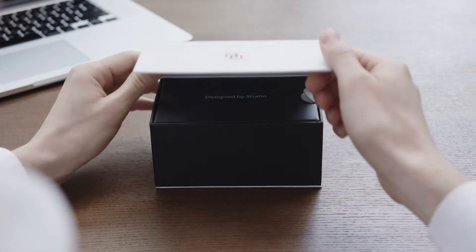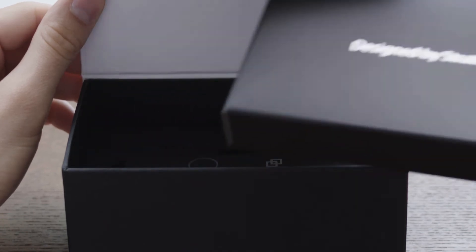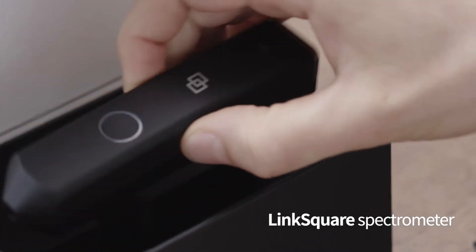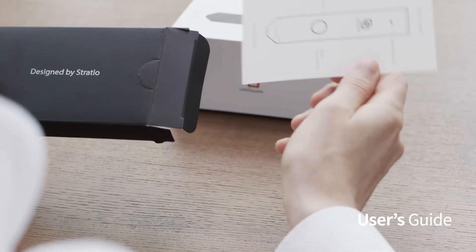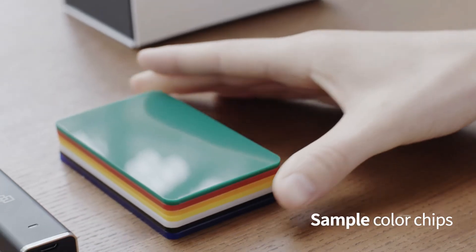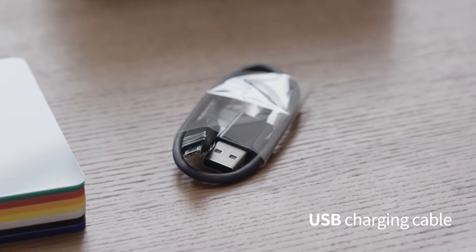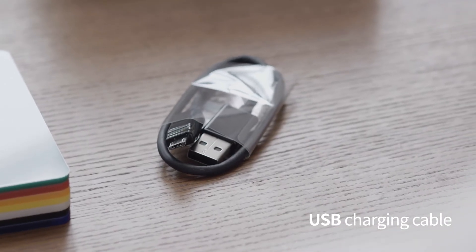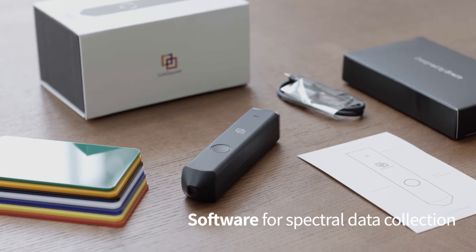Included in your LinkSquare SDK is a LinkSquare spectrometer, a user's guide, a set of sample color chips, a USB charging cable, and spectral data collection software.